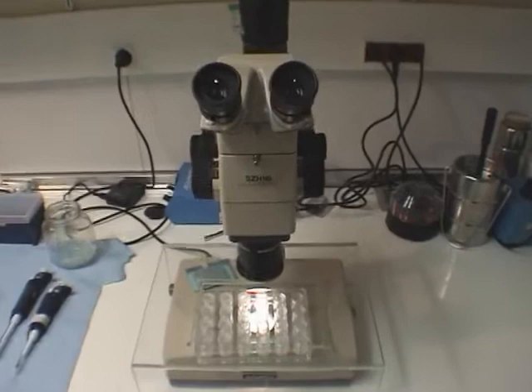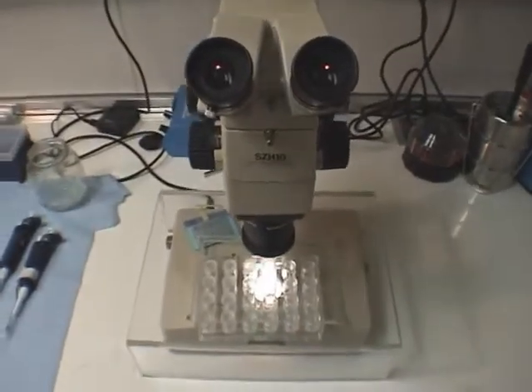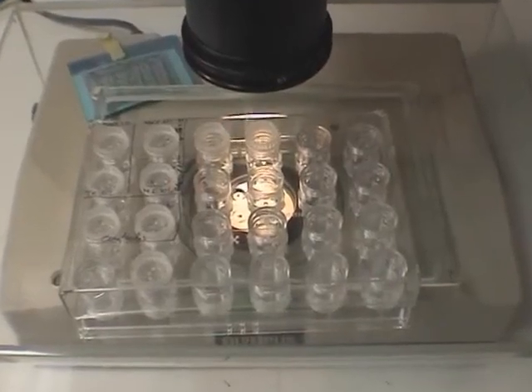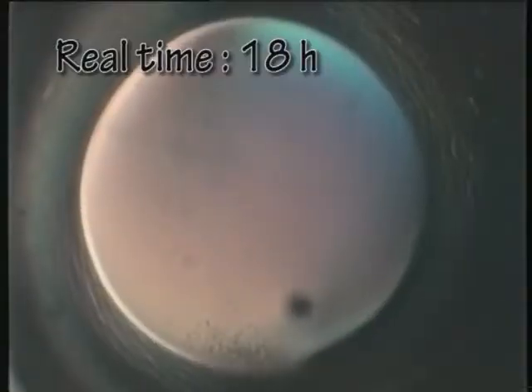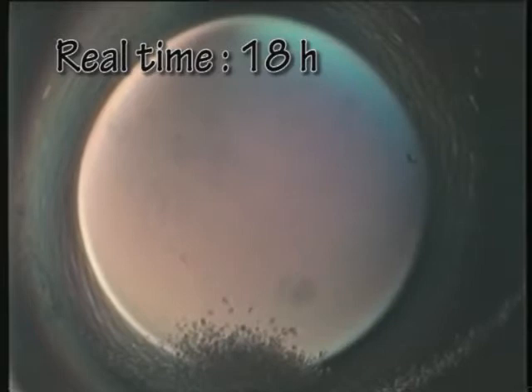This process of concentration makes the target molecule unstable in the solution and causes it to crystallize. The crystallization occurs in a few hours or a few days and can be followed using a microscope.